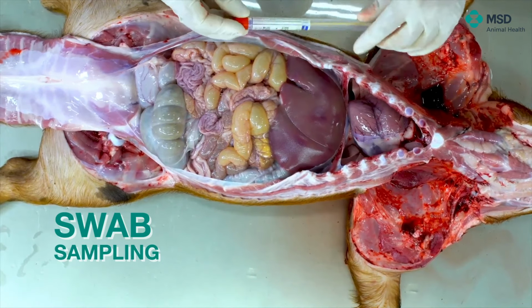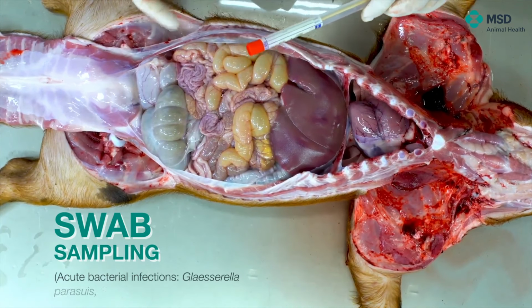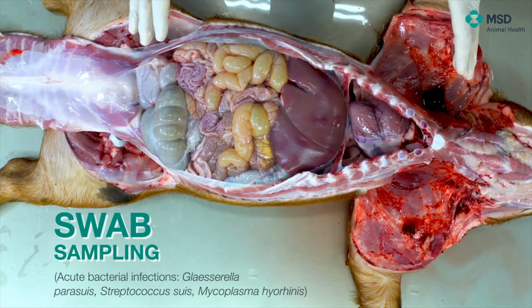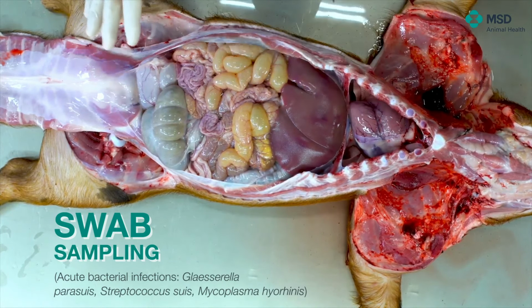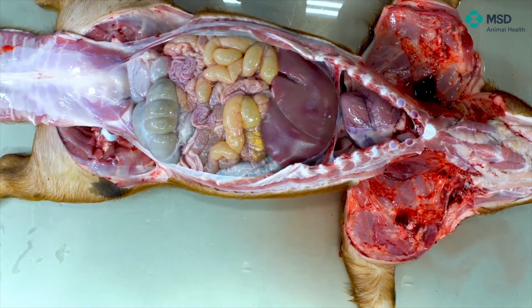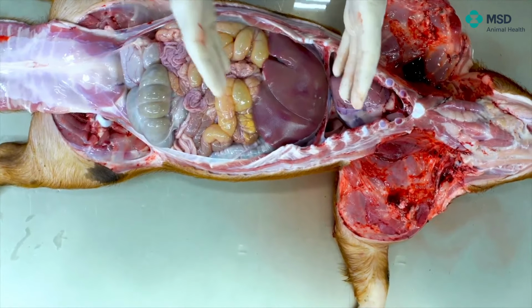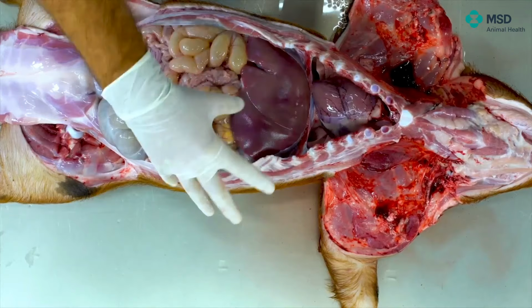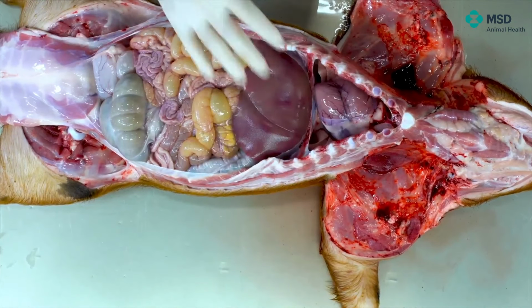Okay, at this stage, it's very important to see if all the organs are in the right position and in the right situation. As you can see, in the abdominal cavity, you always see the liver. Sometimes the spleen is not observable because it's still covered by some of the intestinal loops. We have the urinary bladder, here we have the cecum, and mainly a small intestine.